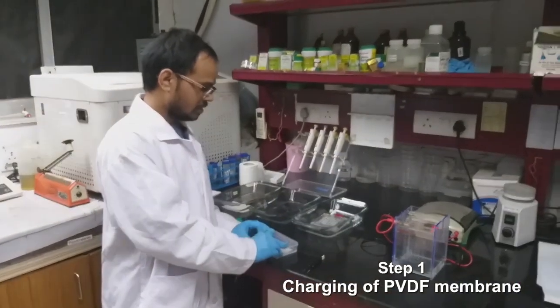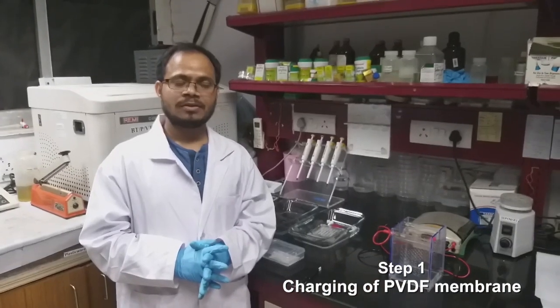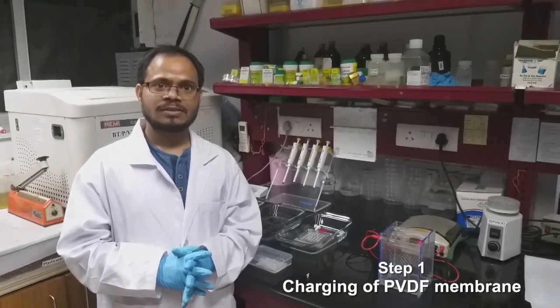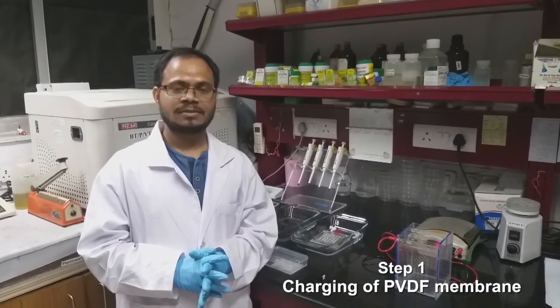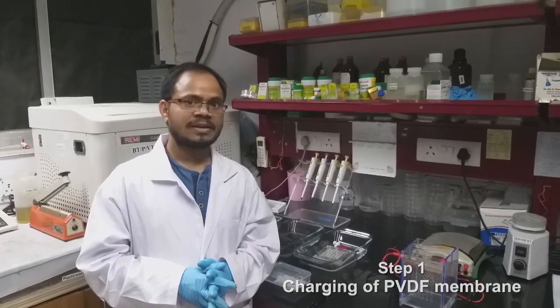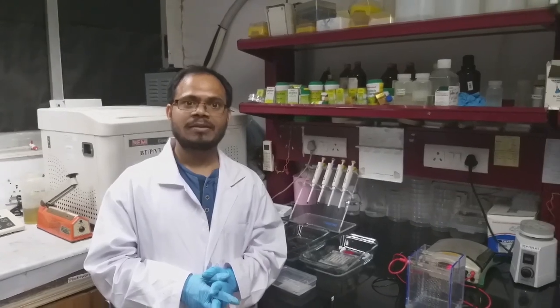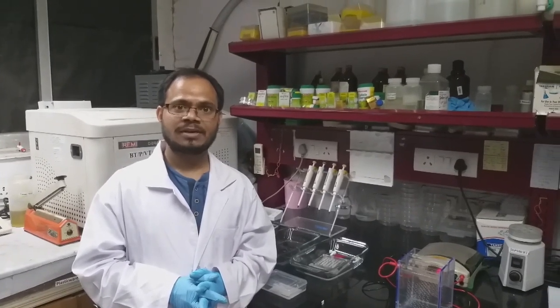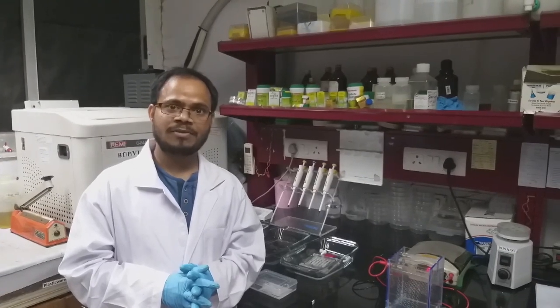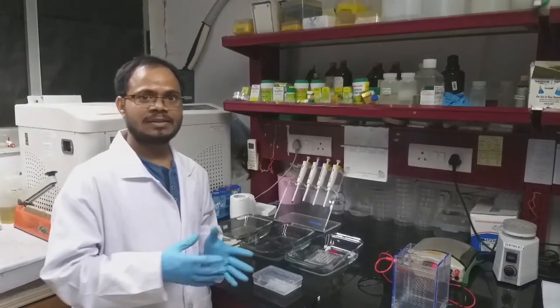A few things to consider during transfer: the buffer should always be kept in chilled condition, because during transfer at high voltage high temperatures are generated, which may degrade your protein or decrease transfer efficiency. That is why we keep the buffer always chilled. Let's start the process.